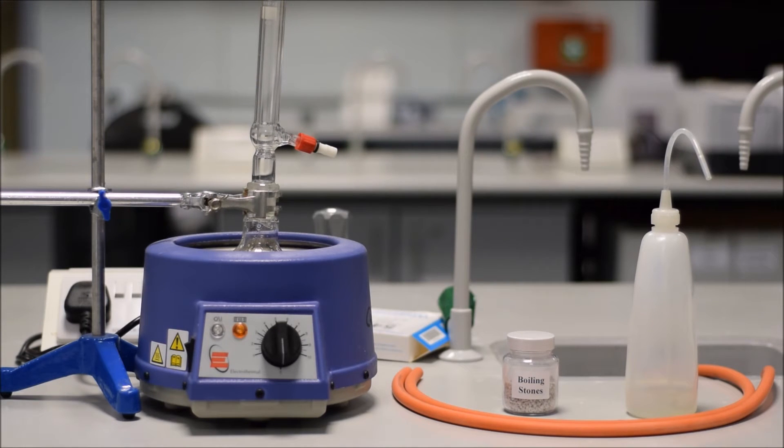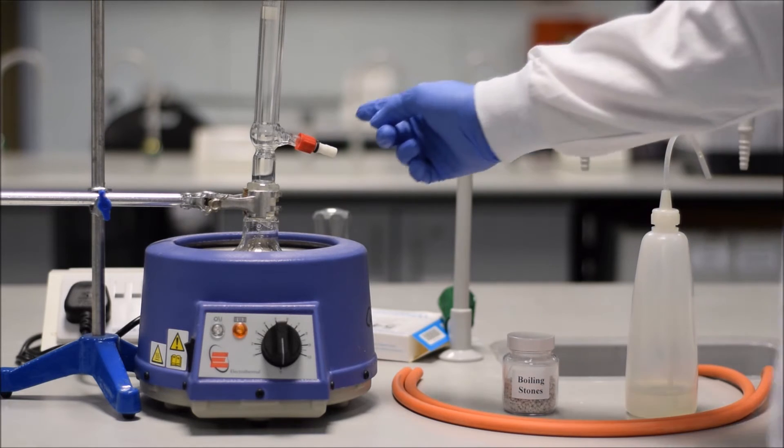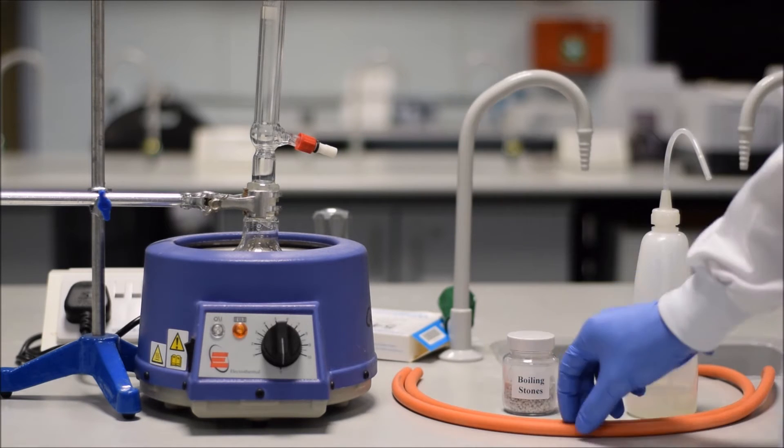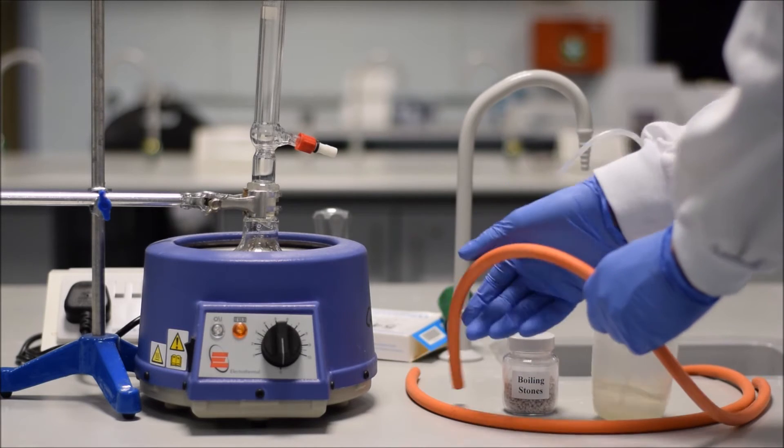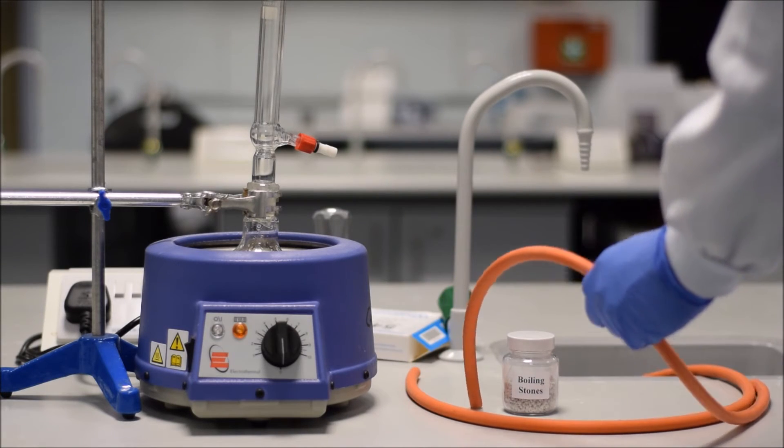Next, put in your condenser and then apply the water. When you were setting up your distillation, the rule was, in the bottom, out the top, that hasn't changed. So the water is going to go in the bottom adapter and out the top adapter.